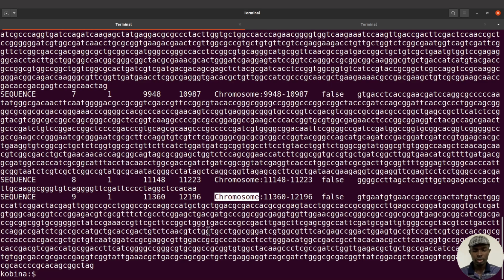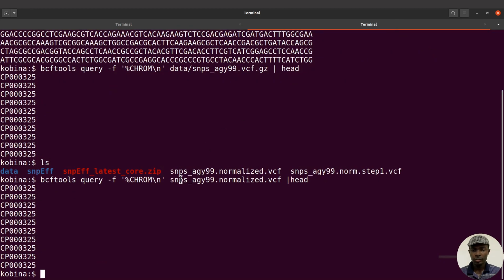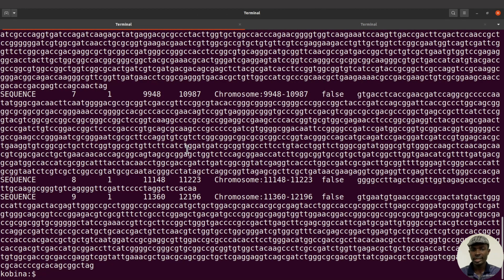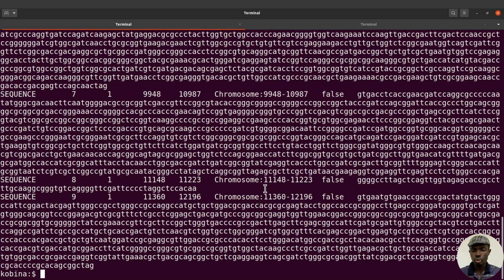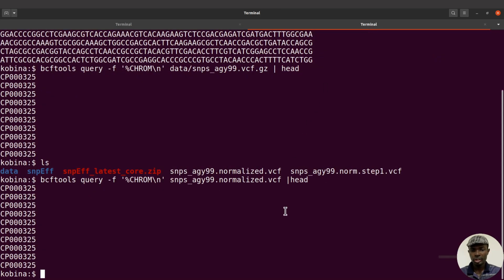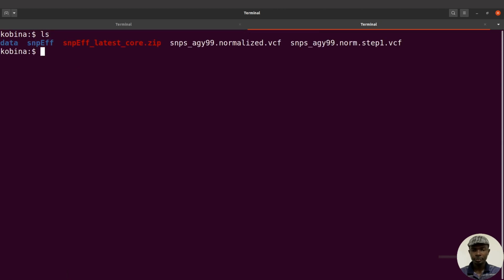I'm just repeating again. To resolve it, what we can do is to rename the chromosomes in our VCF file here, our inputs. We have to rename it so that it has the same name as what is in the SnpEff database. So we have to rename CP000325 to chromosome. That's the key to solving that issue. BCF tools allows you to also rename chromosomes. I've covered that in another tutorial in detail, but I'm going to do a short demonstration here to show how to rename chromosomes. Let's just clear the screen, do an ls and then proceed.